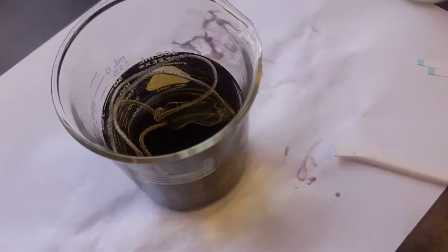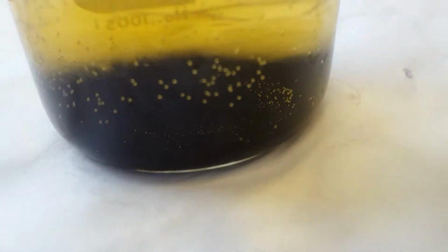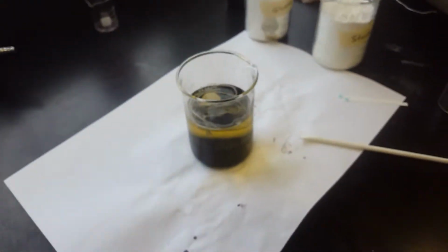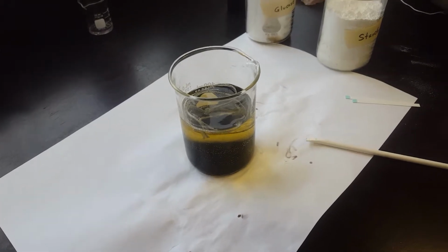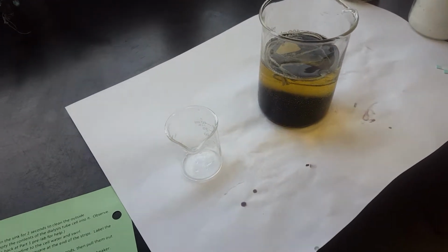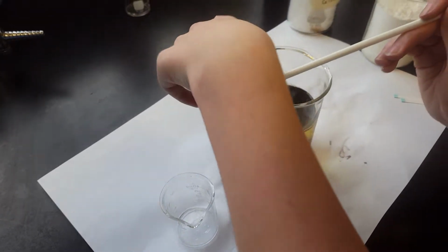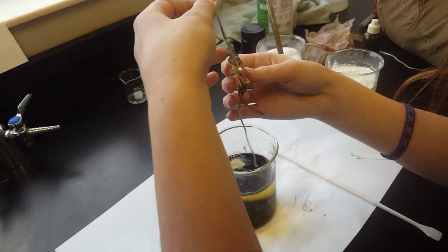So after a night of sitting, the cell is still in the beaker, the iodine's still in the beaker, the starch has kind of settled to the bottom, so it's not making the entire column of water that black purplish color anymore. What we're going to be doing now, just to quickly go over the procedures, is student assistant 1 is going to remove the cell very carefully from the beaker. She's going to bring it over to a sink and give it a quick rinse off.